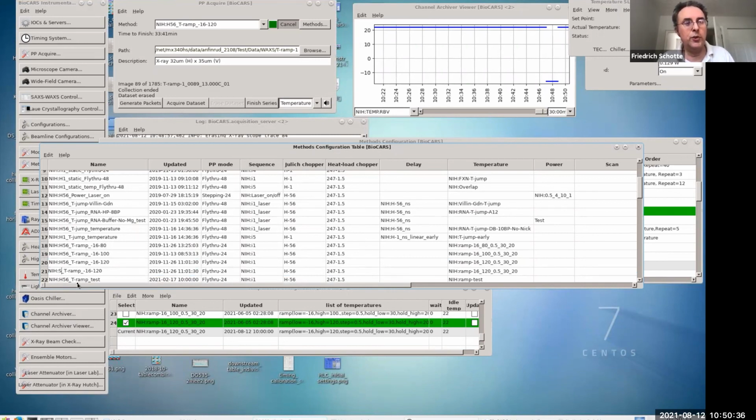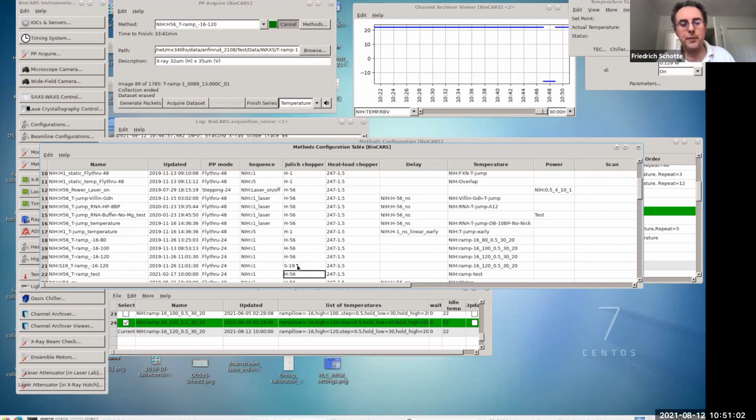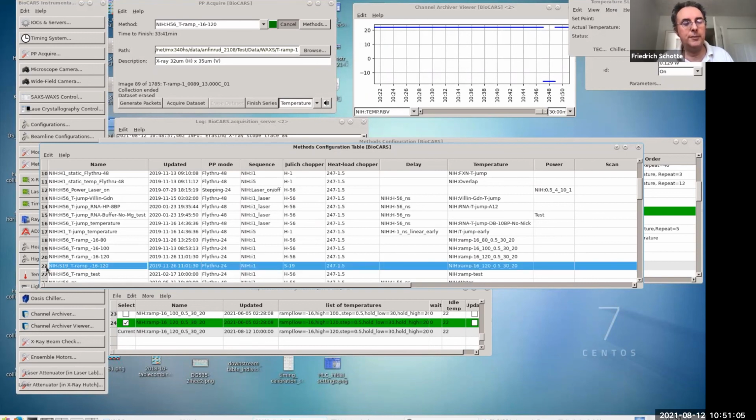So single bunch, we want one single bunch, for example. Or multiple single bunches, maybe 19, so we get more intensity per image. Then you would go in here and call this 19. This way you created a new method by minimal editing, just giving it a new name and changing one parameter. That would be usable from then on every time you're in 24-bunch mode to do the same experiment.